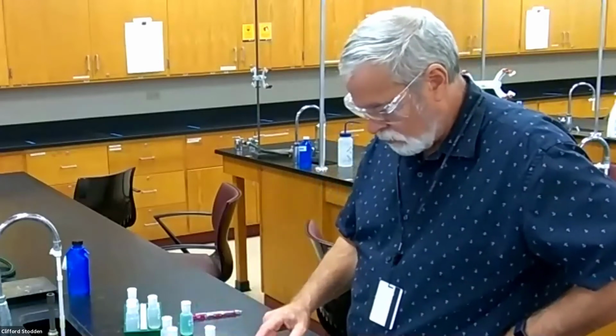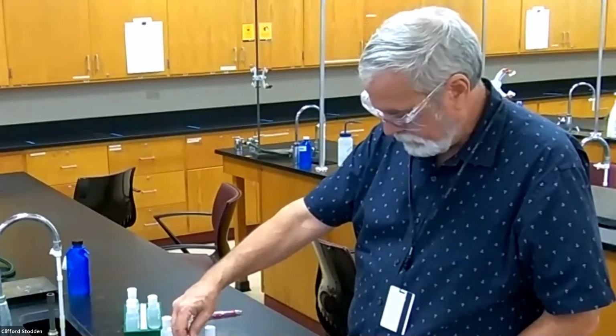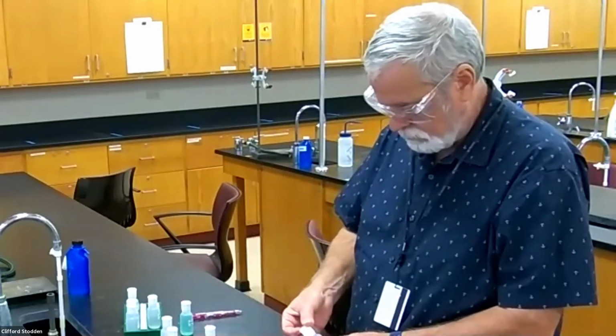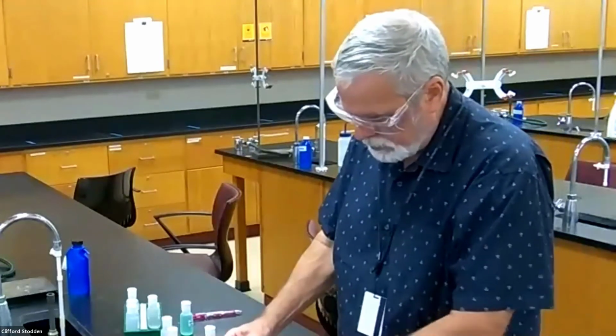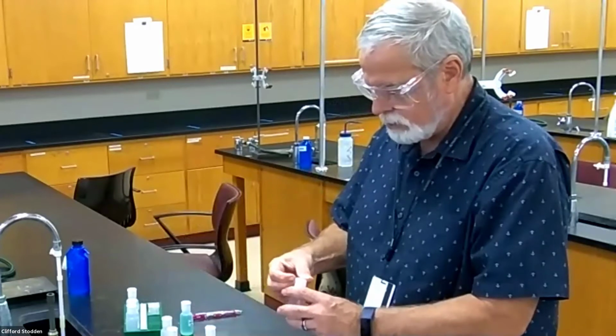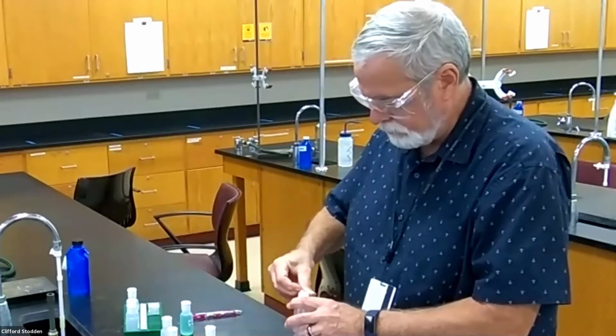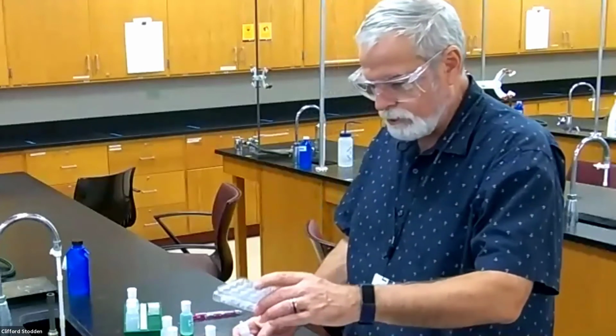All right, so no precipitates on there either. So far we don't have any reactions. And then the last one on the calcium is sodium hydroxide. So I'm going to put that in the very last well here. Sodium hydroxide precipitates with a lot of it. I put 4 drops in there.